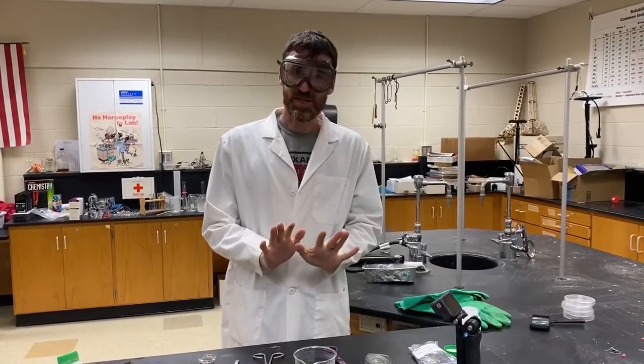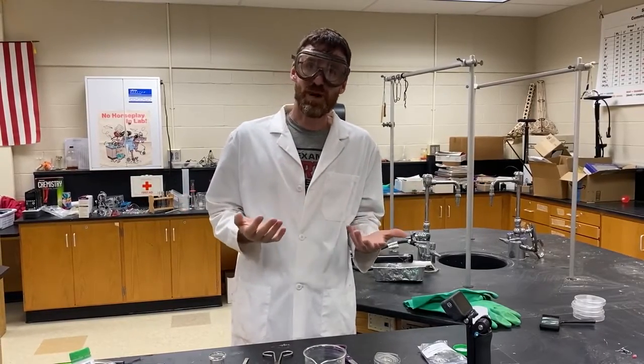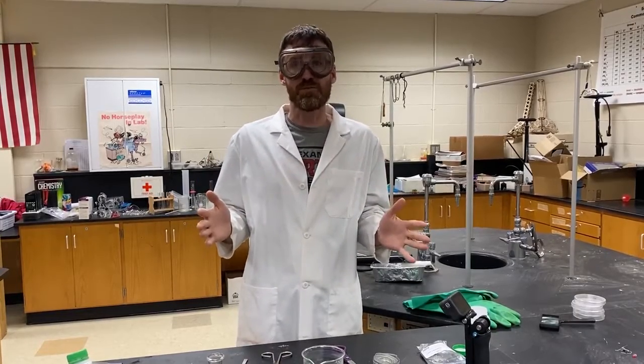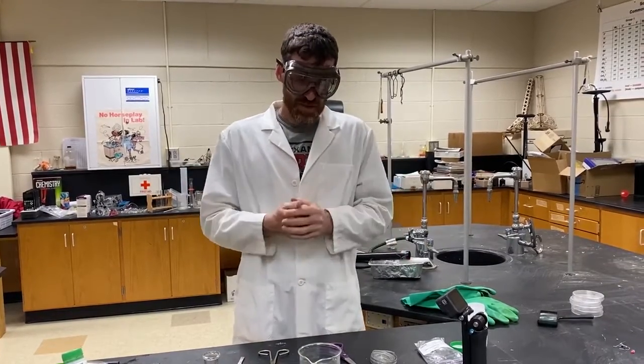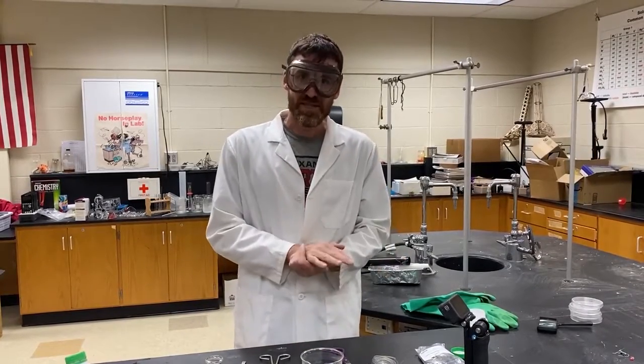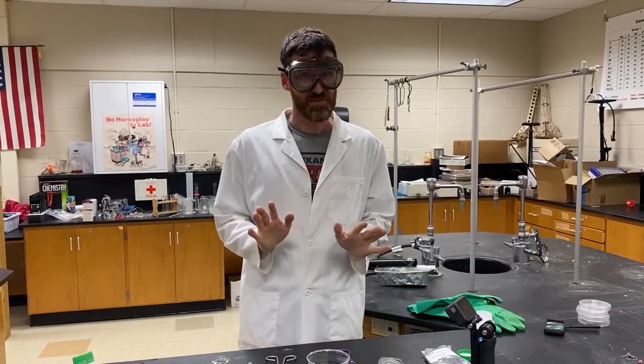So, that was not too exciting, but we all need a frame of reference. I talked to my kids about in relationship to what, relative to what. A frame of reference is very important in physics and chemistry. And so this is our reference right there. It's not super exciting, but it gives us the standard to which we can compare the other elements, okay? So on to the next one.